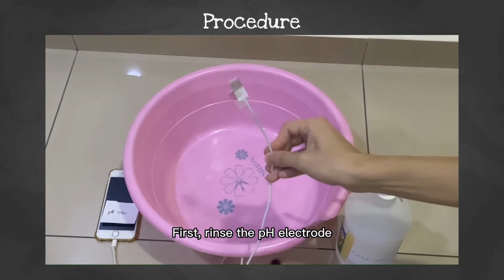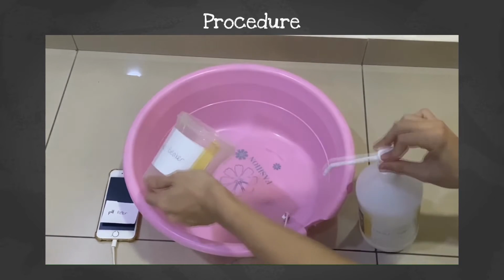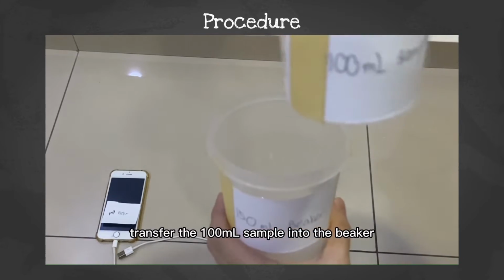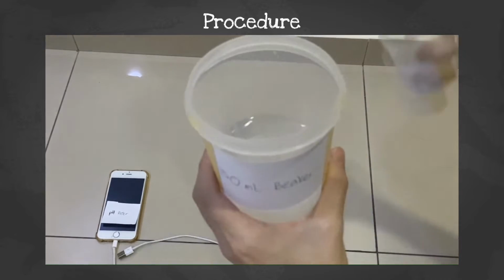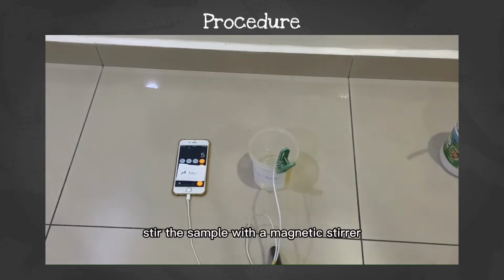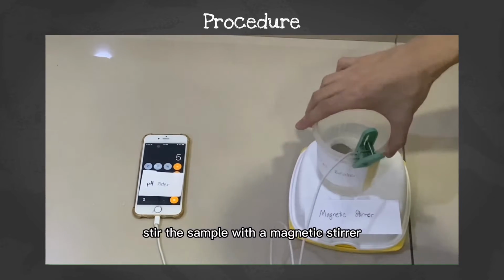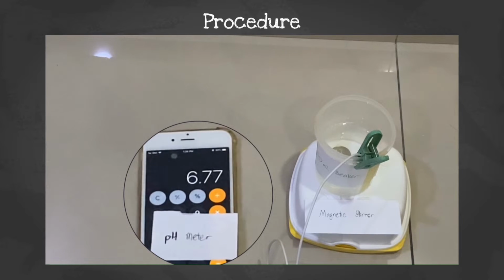First, rinse the pH electrode and the beaker with distilled water. Transfer the 100 ml sample into the beaker. Dip the pH electrode into the sample. Stir the sample with a magnetic stirrer. Record the pH when a constant reading is obtained.